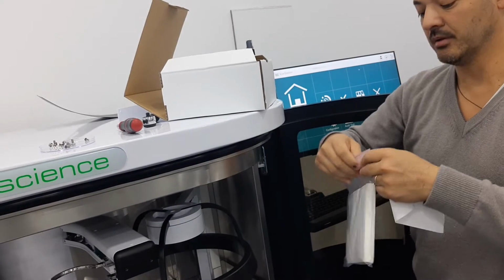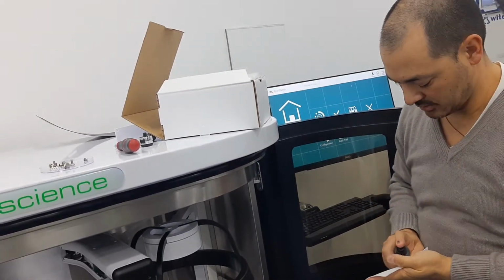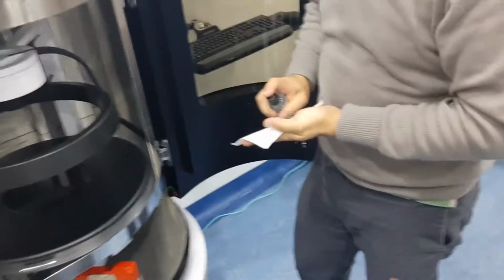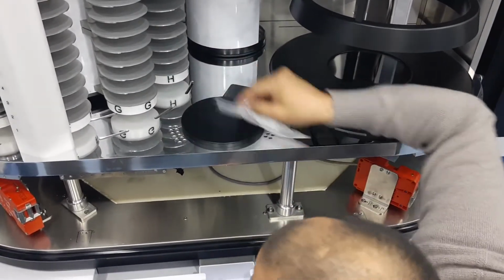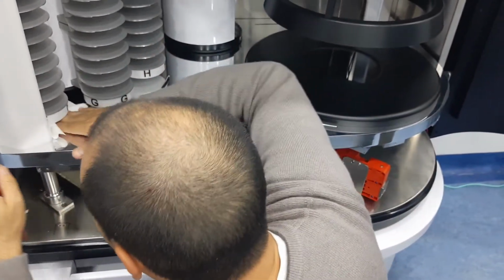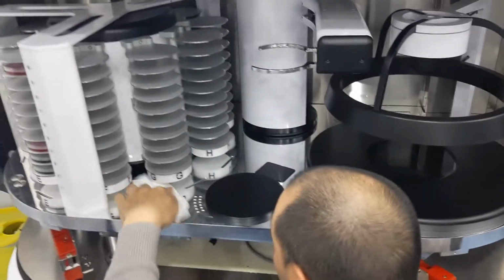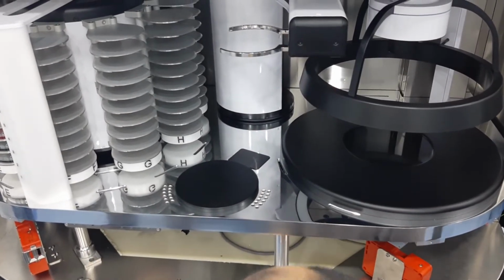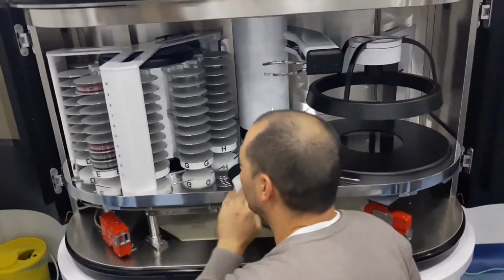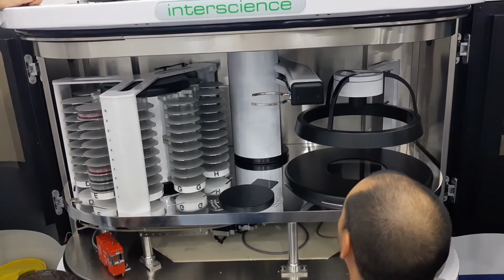We provided a few. This is supposed to be like a lint free. This is a special product for optics. You can clean the glass panel with that, no problem. It's made for it. Oh, I touched the grease. Greasy. Yeah, so I think we saw everything about maintenance. We should be okay.